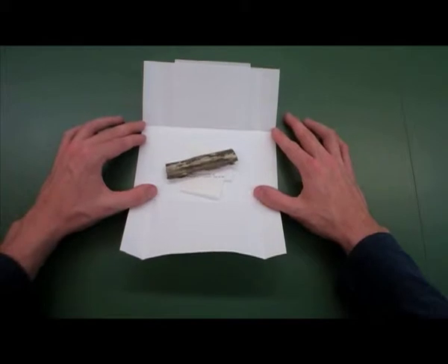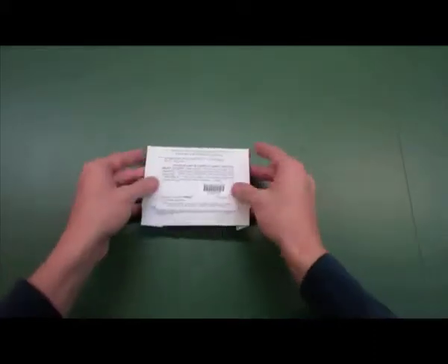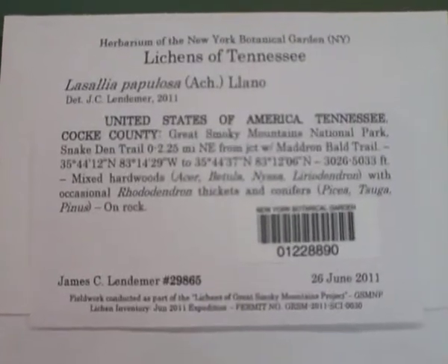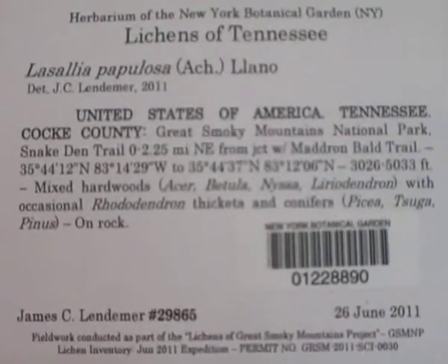In the herbarium here at the New York Botanical Garden, individual lichen and bryophyte specimens are stored in separate packets made from archival acid-free paper, accompanied by a label on the outside detailing present and historic taxonomic determinations, along with collector, collection date, habitat, and locality information. Packets are adhered to one side of a standard herbarium sheet, with anywhere from 1 to 10 packets, generally from the same geographic locality, attached to each sheet.